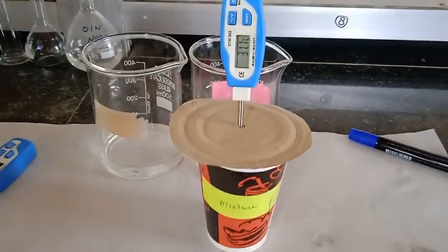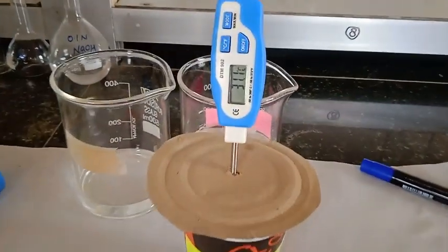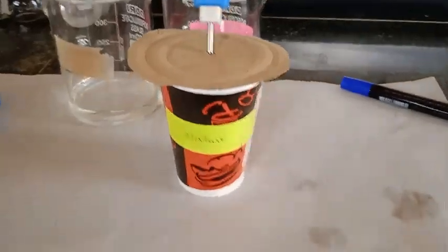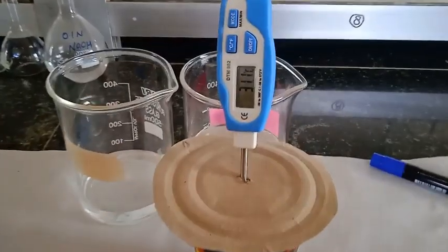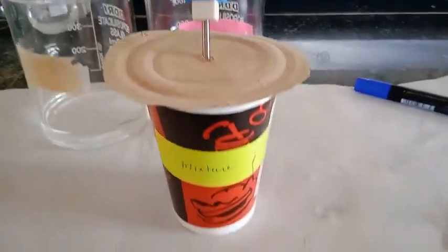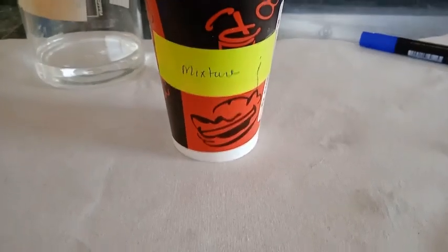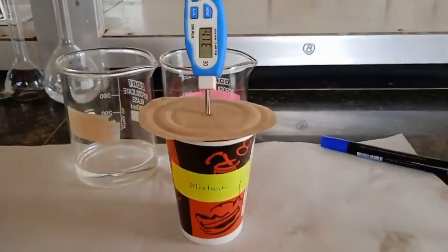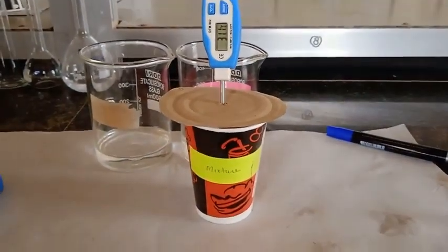We have recorded these readings and now we are going to make the graph for these readings. Before making the calculation, we understand the formula which we are going to use to calculate the heat of neutralization.